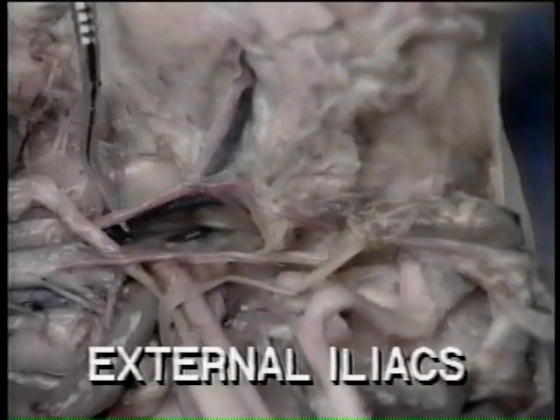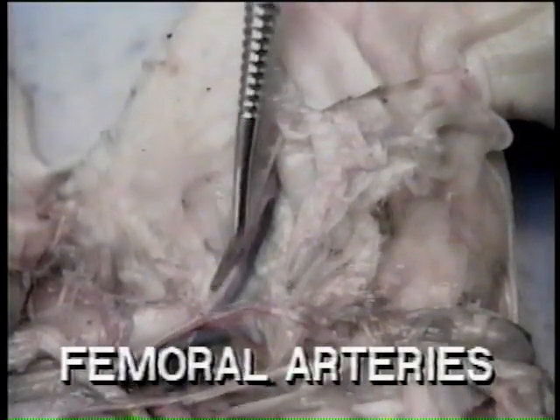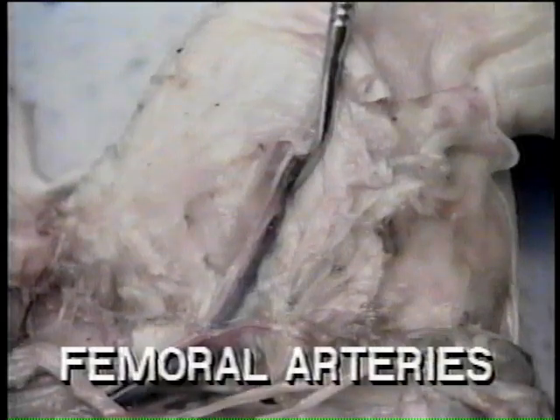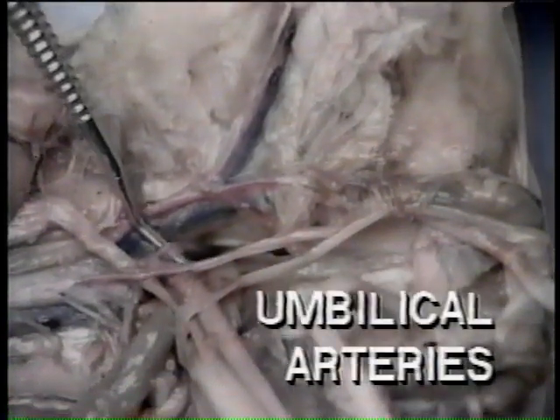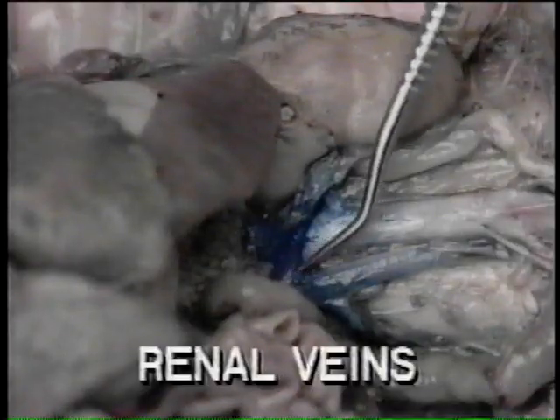The external iliacs give rise to the femoral arteries which supply the hind limbs, and the internal iliacs that give rise to the umbilical arteries. Renal veins receive blood from the kidneys.